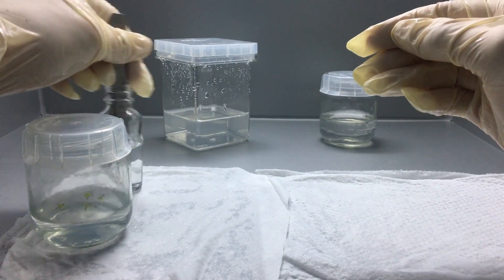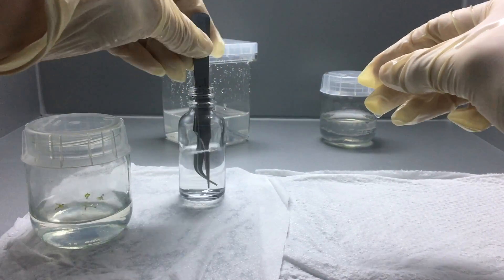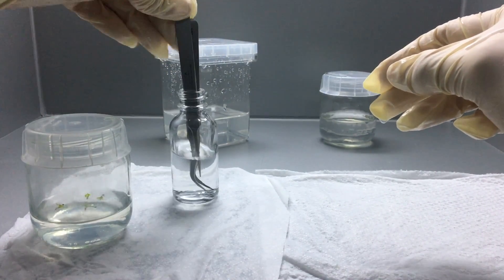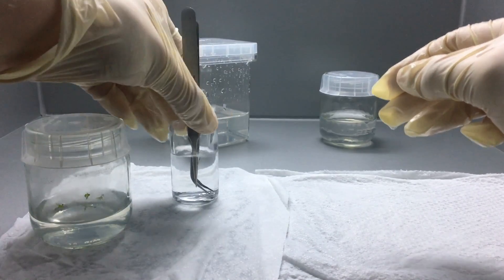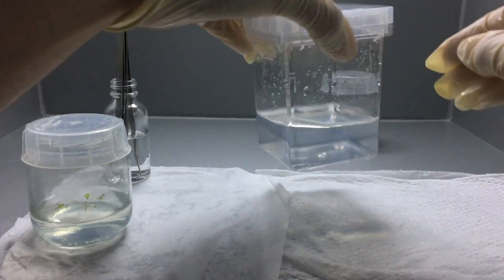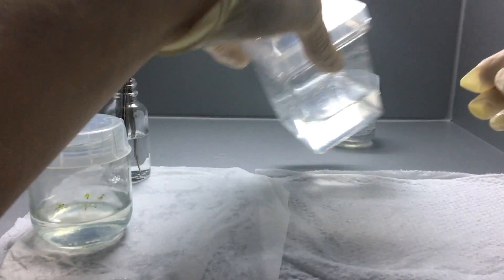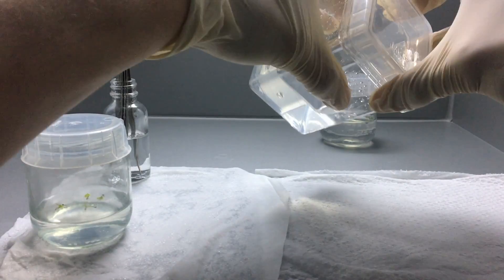They're all making their first traps right now. The cotyledons are either broken free of the seed coat or stuck there, but I can still see at least one trap forming on each of the seedlings. Three of them have their root poking through the gel and one doesn't, so I decided to move them over, give them a little more room in this new vessel here, this big cube.